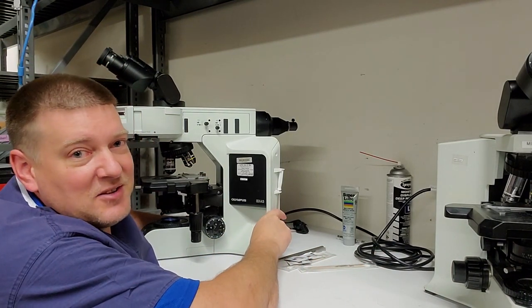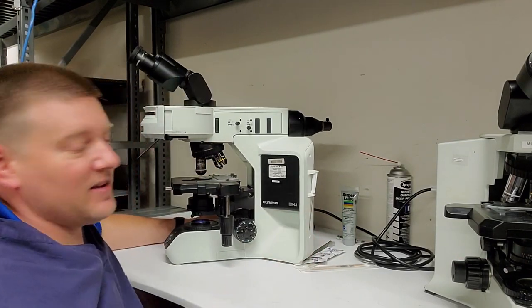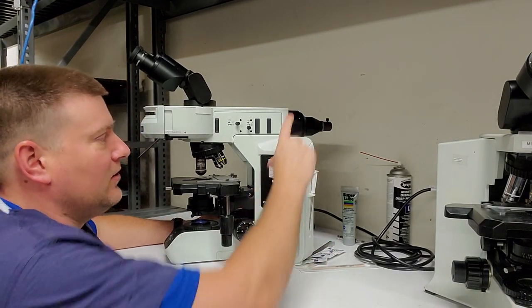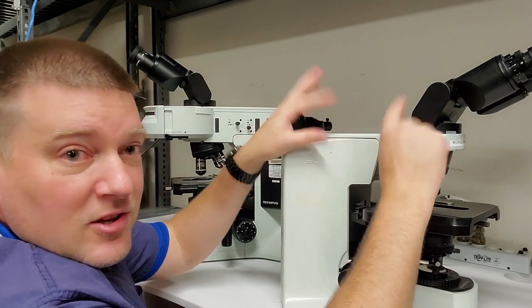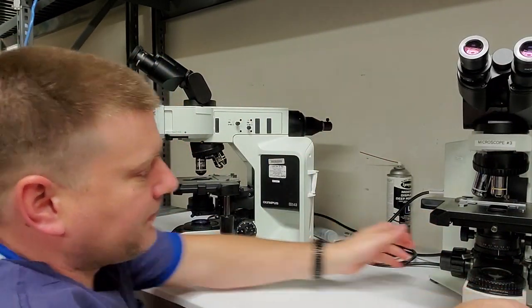Now we're getting into the expensive ones, guys. Not that those aren't expensive. This one right here, the Olympus BX43. Now this one is a bright field just like that one, but look at this headstock that they put on there. It's almost exactly like this one. See that? Just this piece comes off, and they put this one on here.